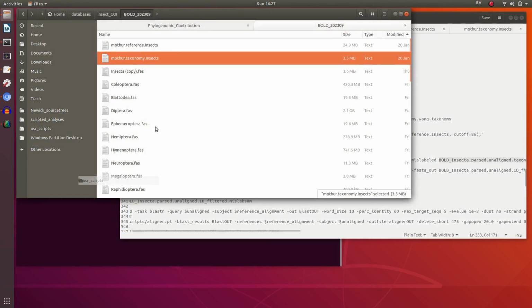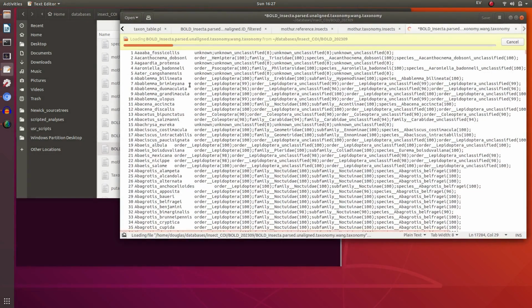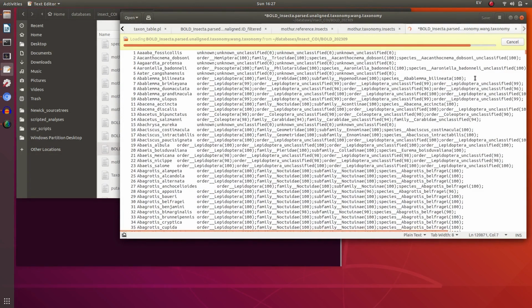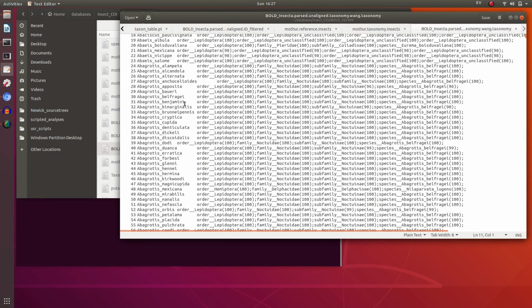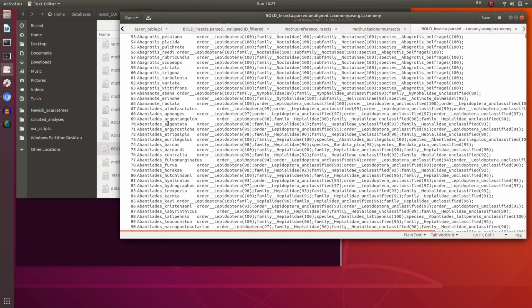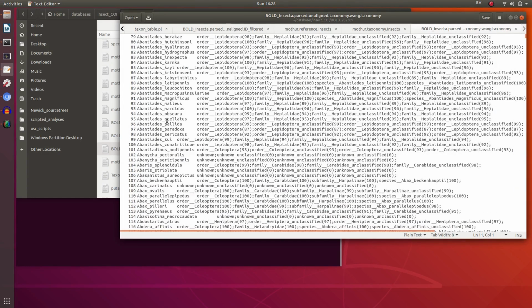I can show you what that looks like. So we have our input, which is our COI database, and we've identified it against something quite similar, and it will give, in some cases, it's found the same thing in the reference database, and in other cases it's found something pretty similar. Now what we're looking for is where a sequence has matched to a taxon which is totally different. So that's what we're doing here.